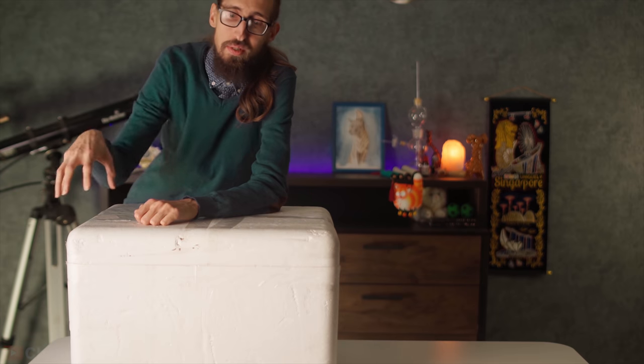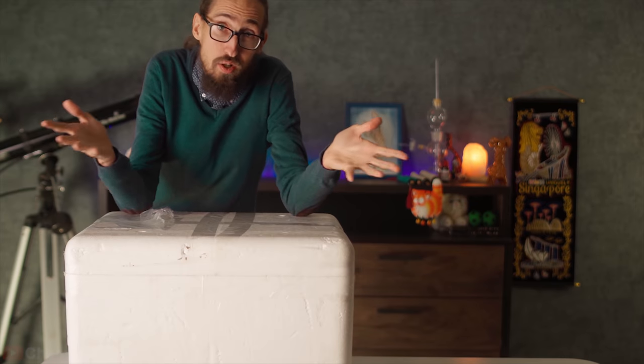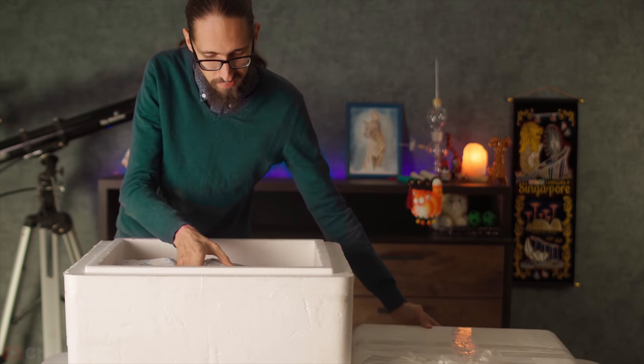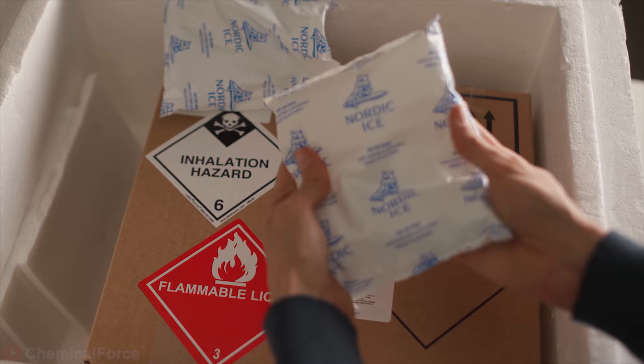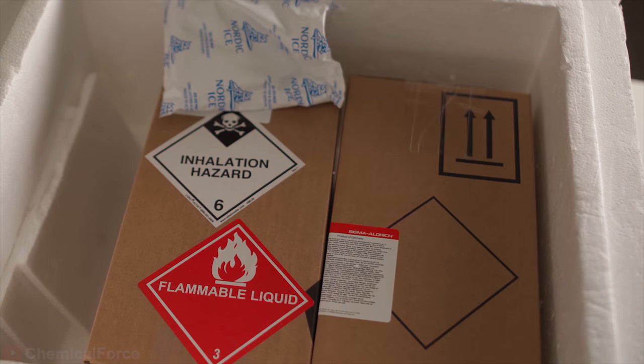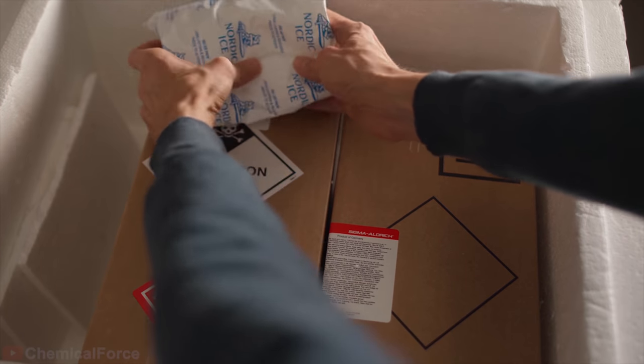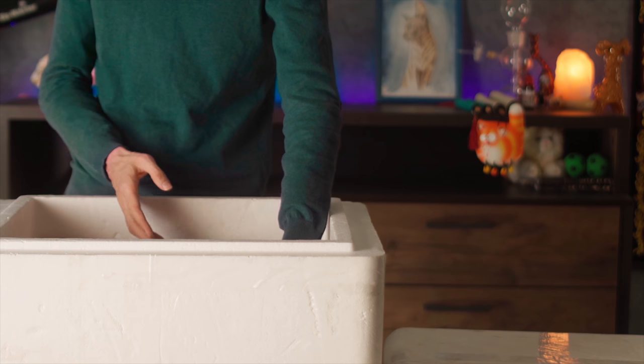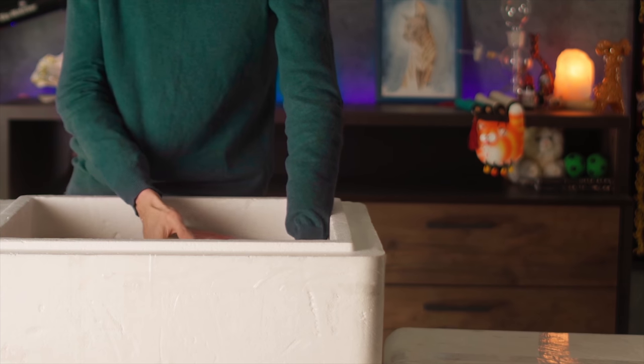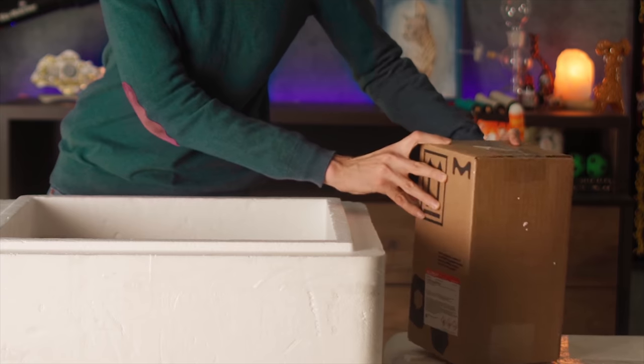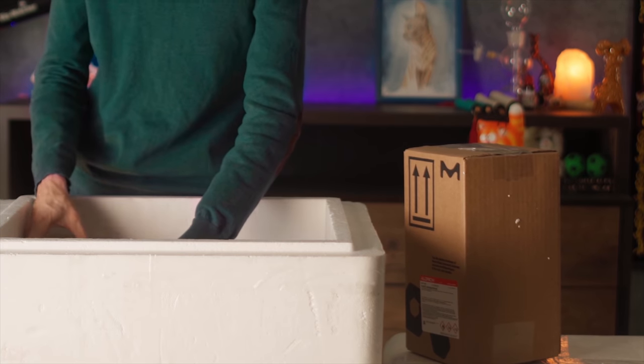Sometimes it happens that you need to buy some chemical reagent that must be stored at low temperature. In this case, supplier companies pack them in a thermal box made of styrofoam, and some gel refrigerant packs are laid around them in order to maintain low temperatures. So let's take a look at this. Still cold. Well, I have two such reagents right now. We won't need the first one today. I'll make a separate video about it in the future. But we do need this one right now.